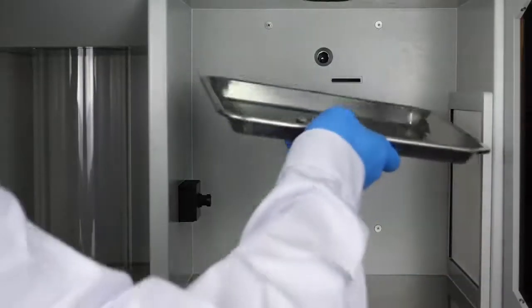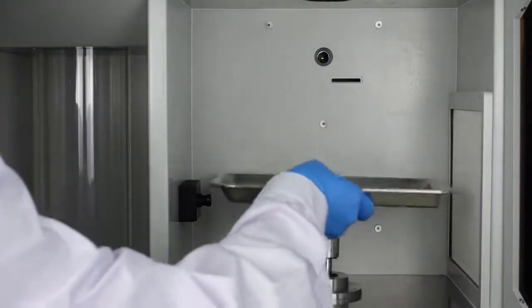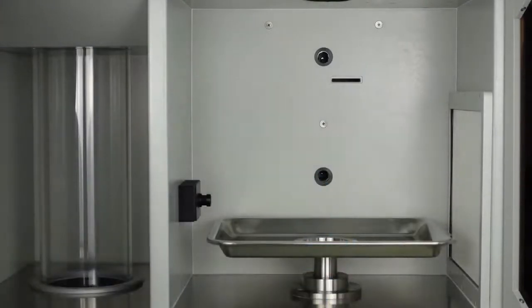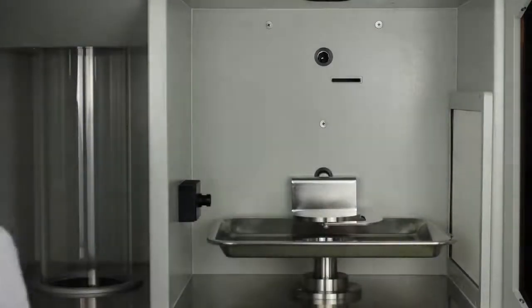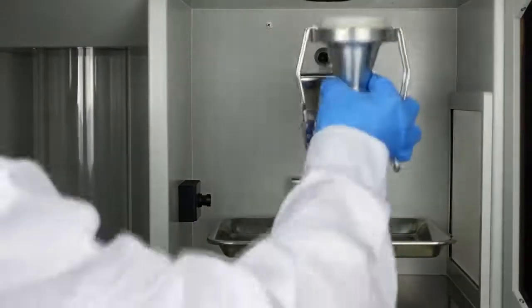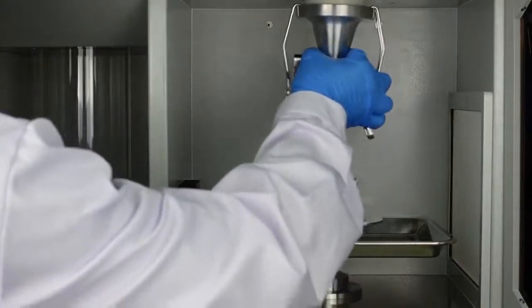Install Stock Pan Platform C03 for angle of repose and angle of fall. Install Platform C02 for angle of repose and angle of fall. Install Funnel Clip C12 onto Feeding Assembly.